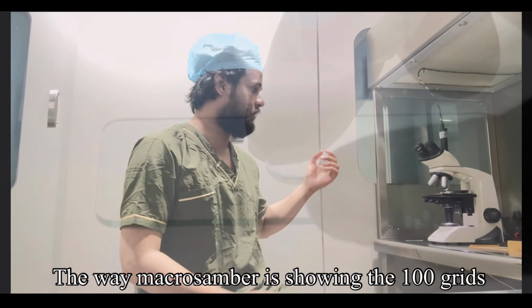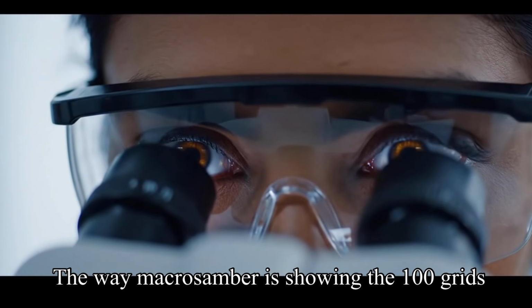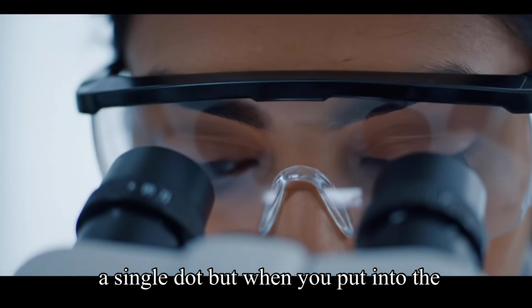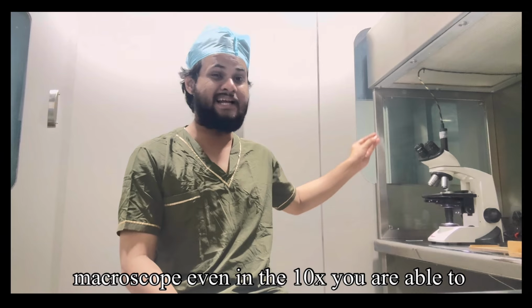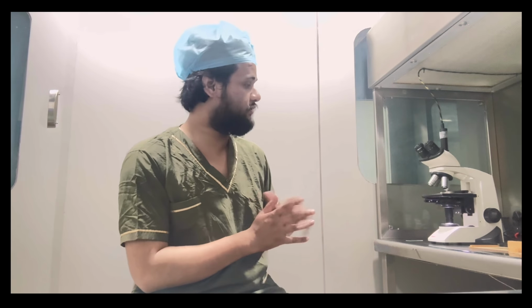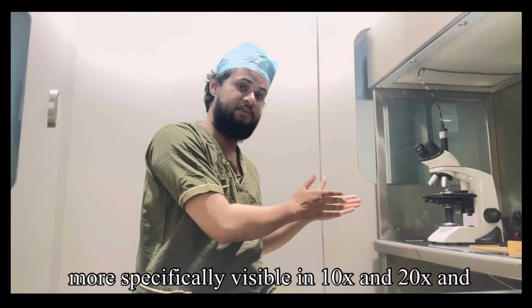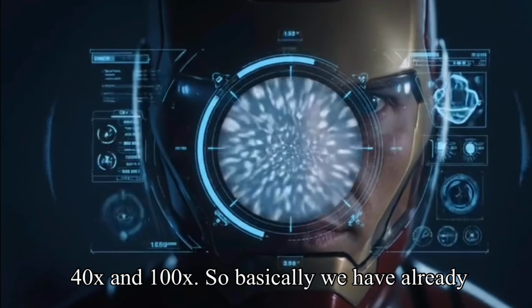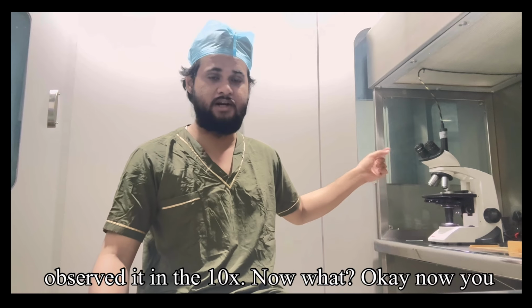The Makler Chamber has 100 grids, and with the naked eye you won't be able to see a single dot, but when you put it into the microscope, even in 10x you are able to view the 100 grids. It will be more specifically visible in 10x, 20x, 40x and 100x. We have already observed it in 10x.